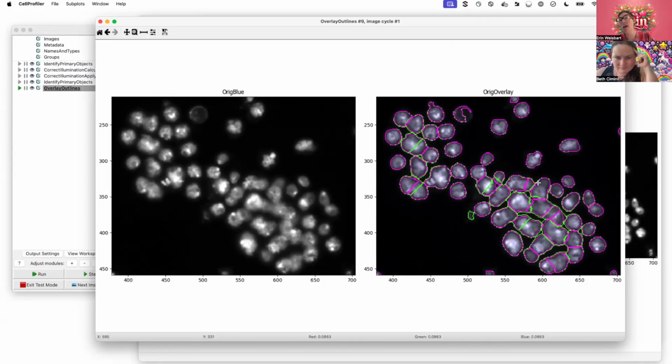But hey, maybe here I'm noticing, oh look, it's now over segmenting here. So it's interesting, again, any corrections really need to be determined empirically. I'm seeing some of the things it's doing better, but here's an example of it being worse. It has divided this into two cells with a line here, and that sure doesn't look like it should be divided there to me. So you want to find a balance of over versus under segmentation. There's always going to be a little bit of one, a little bit of the other, and you want to find the happy medium where you're getting as little as possible of both.